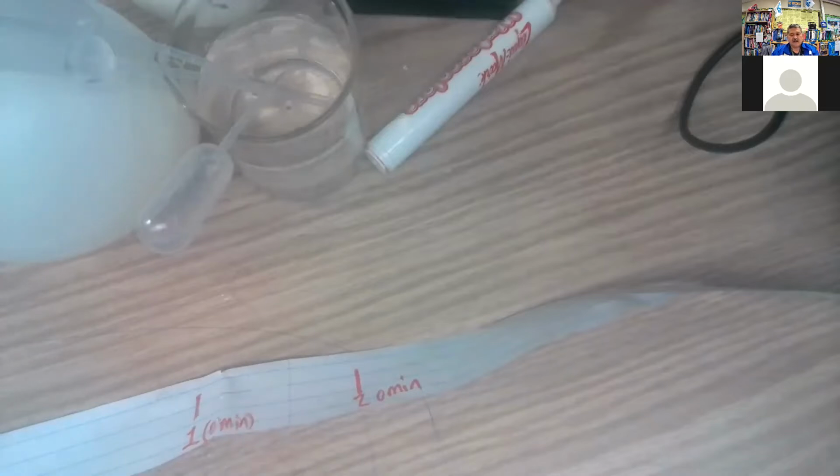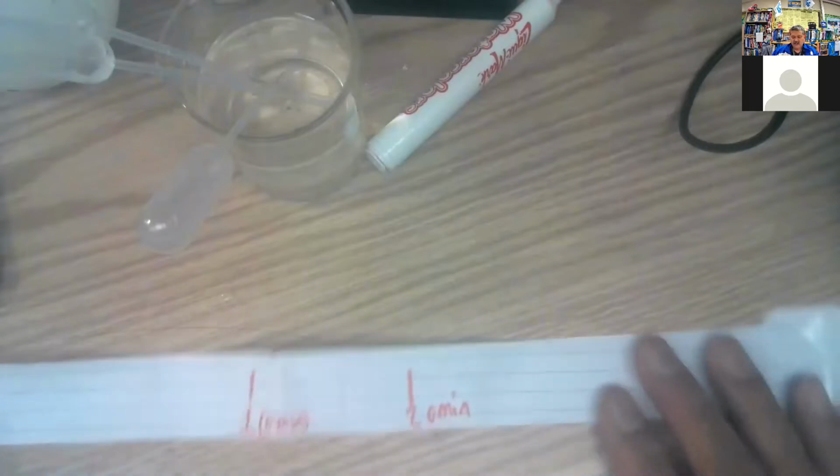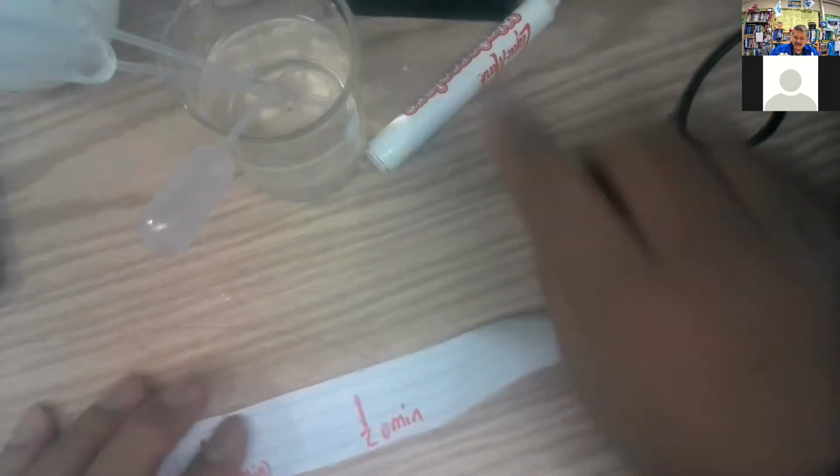So 5 minutes we need to do that. We got the 1 and the 2. The 2 at 0 minutes looks like this. That's it right there. Okay.